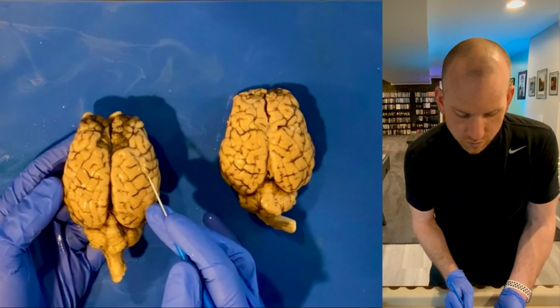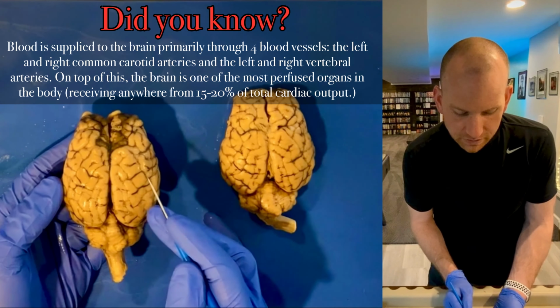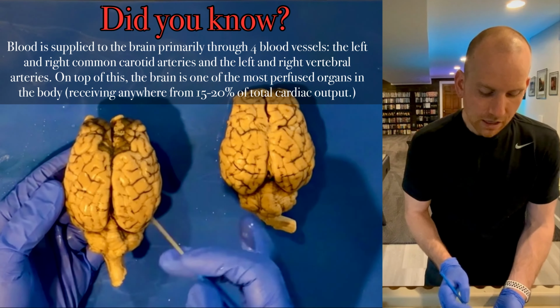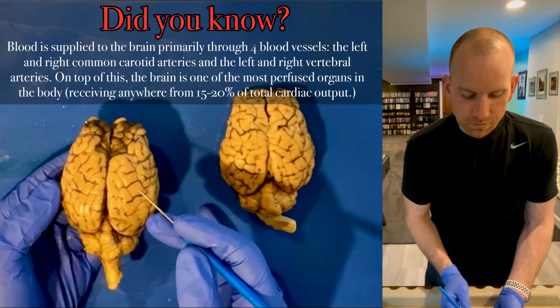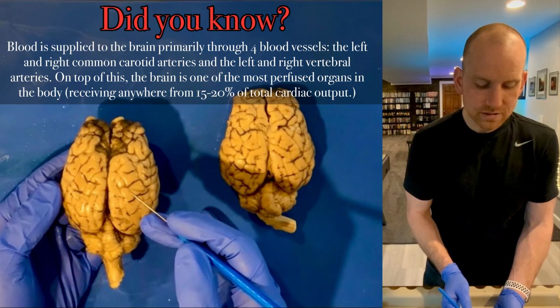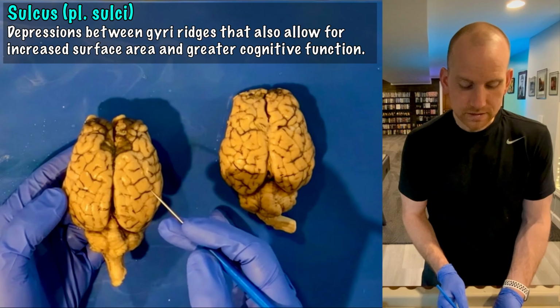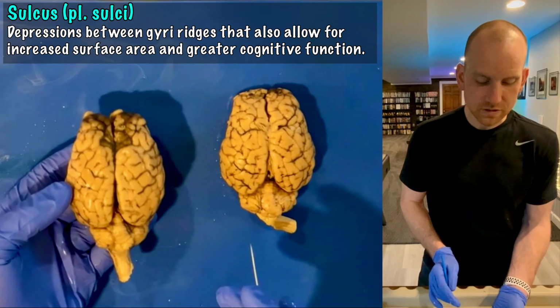Now, you can actually see where there's all these blood vessels on the brain, all these blood vessels that are feeding the brain. There's probably nerves in there too, I could say, so they are also innervating. These blood vessels, though, lie in these valleys, these little cracks, and those are called sulci, S-U-L-C-I, and one of them is called a sulcus. So that's some external things that you can see.